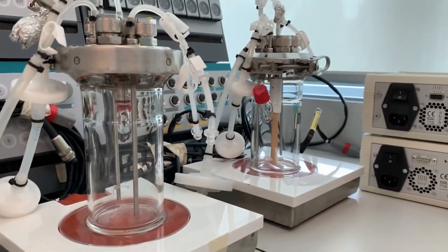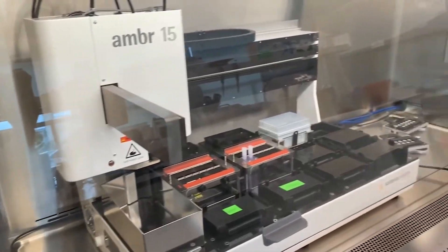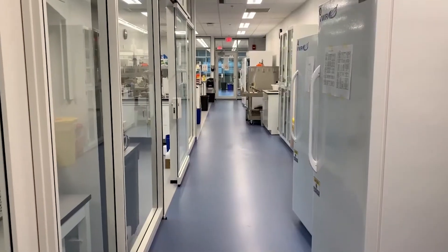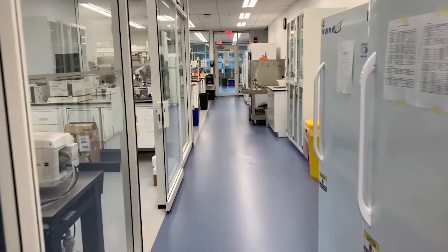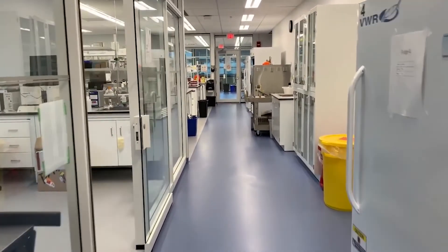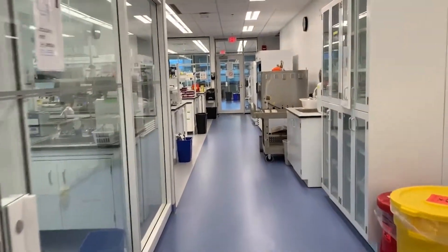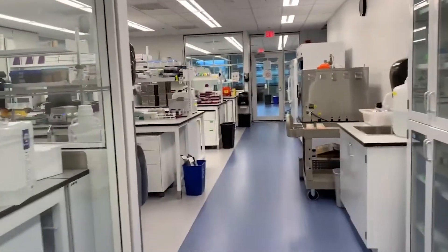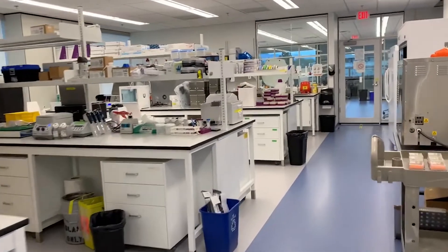This is also an automated and high-throughput way to grow cells. In our lab's research cycle, our experimental results then feed back to our computational work, which is then optimized to provide new and more accurate predictions.